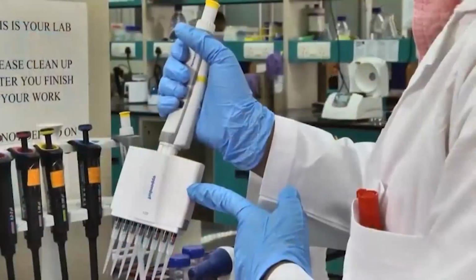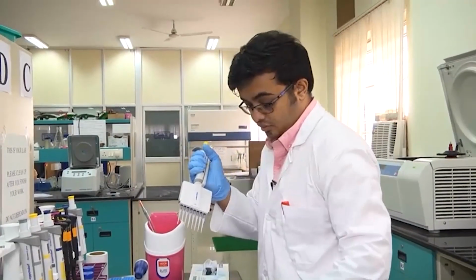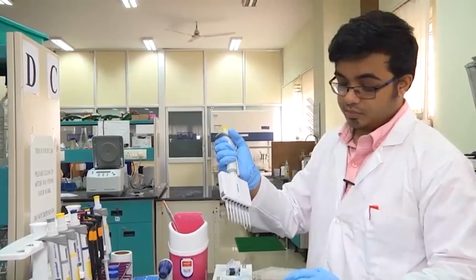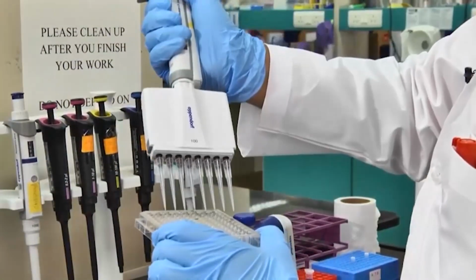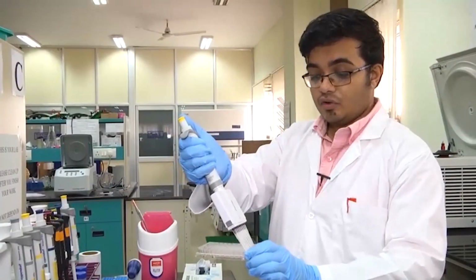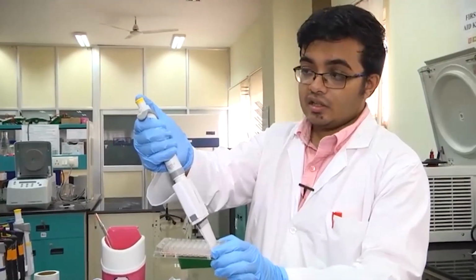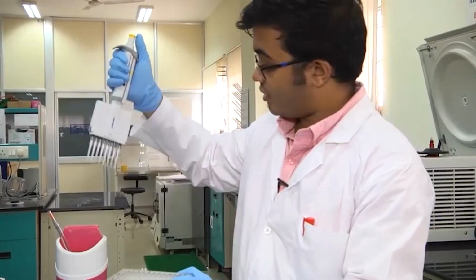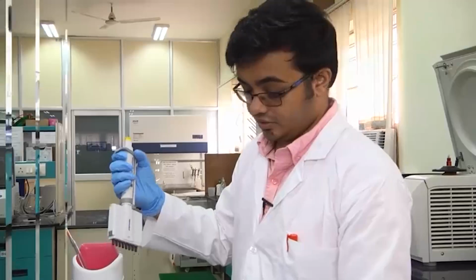So the idea is, I don't have anything to show you right now, but in many aspects of molecular biology or biochemistry, you will be using 96 well plates. Suppose you have to collect a particular solution from here in equal volume. At that time, you dip it in here. I know it's empty, but I'm just showing you the utility. You dip it in here, you collect the liquid, and then you dispense it somewhere else. And once it's done, you eject all the tips simultaneously.